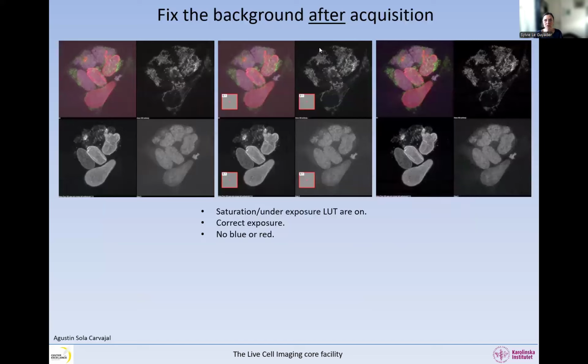Now, the background that you have left in your image, doesn't matter where it comes from, you can easily remove it after acquisition, and that is valid. Once you have this image, you see there's a high autofluorescence of the mounting medium, for example. So the background is gray. It's not a very pleasing image to the eye, but it doesn't matter because we can subtract the background, and clearly we keep this original image.